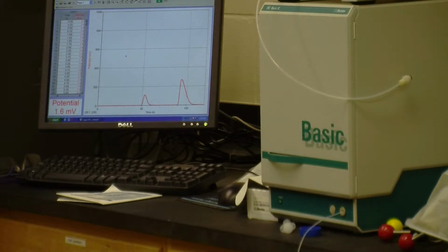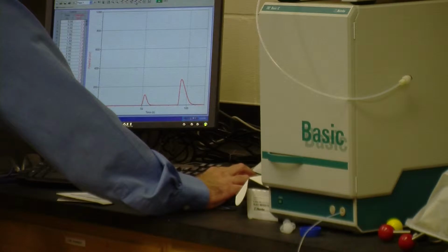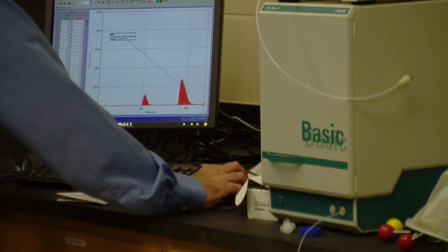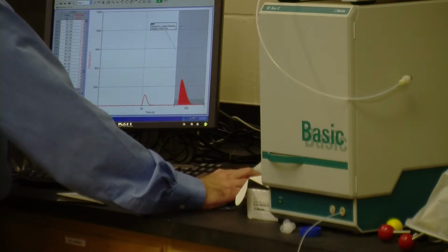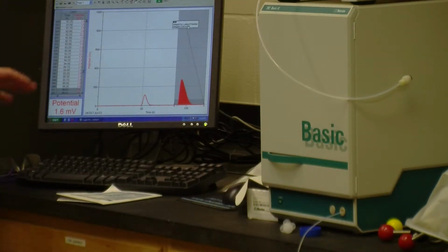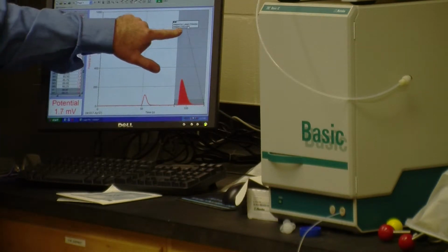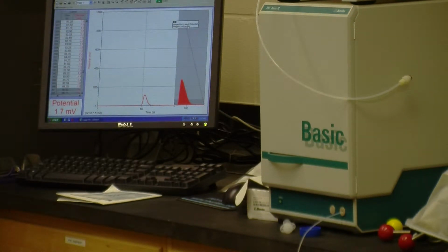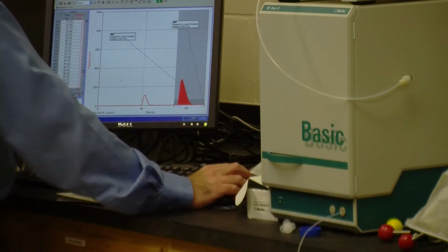I'll go ahead and print these off for you. Before I print them off, I'm going to have the computer determine how big the peak is, because how big the peak is tells us roughly how many of each kind of molecule is present. So I've highlighted it, and it's calculated an area, literally 1/2 base height, because it's pretty much a triangle. And we'll do that over here.